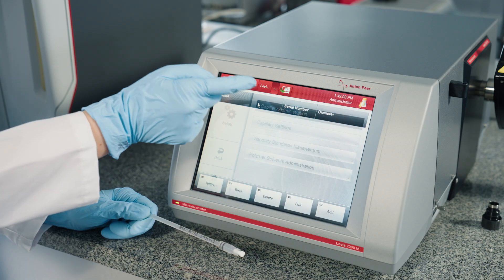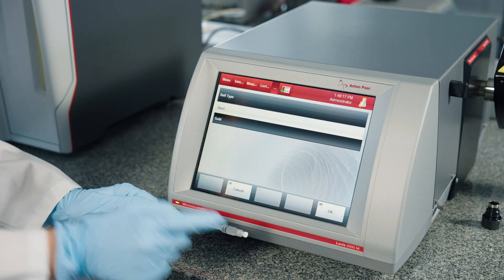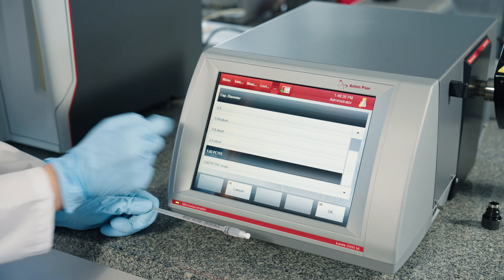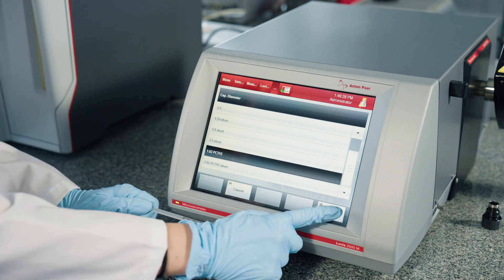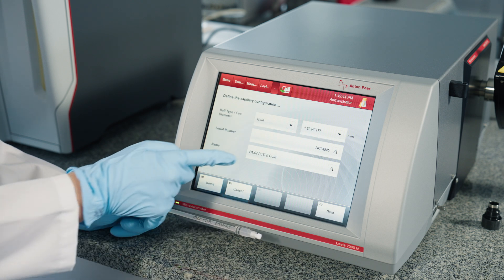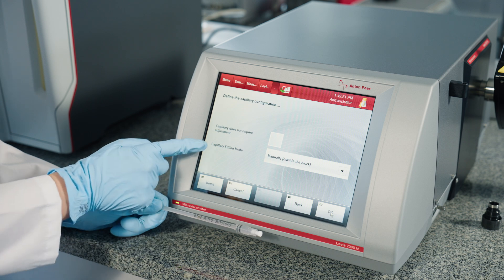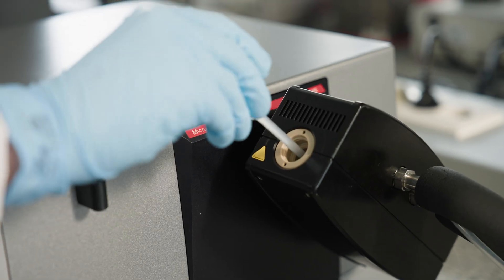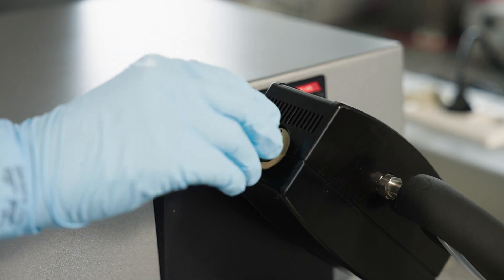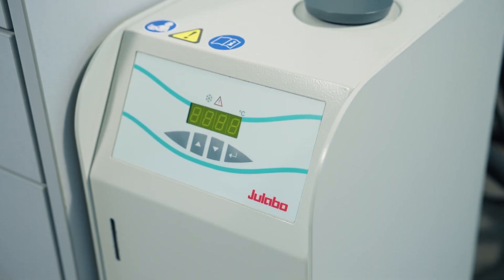In the capillary administration, select the ball type, which is gold for these samples. Select the type of capillary, which is PCTFE for these samples. Enter the serial number of the capillary, select the filling mode, which is manual in this case, and then insert the capillary in the capillary block. If performing measurements below 5 degrees C, the capillary block needs to be connected to a circulating liquid cooler.